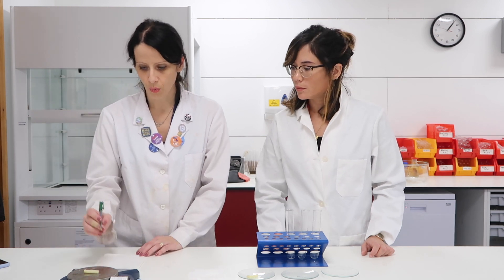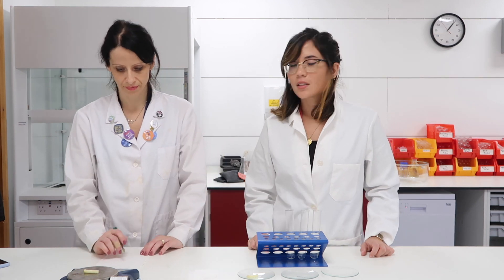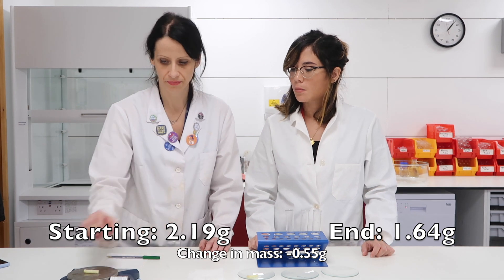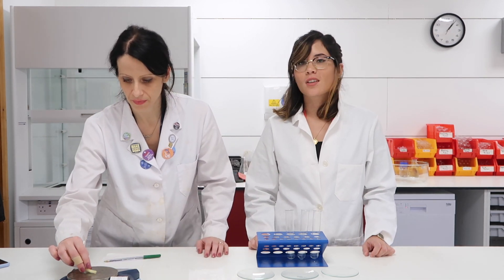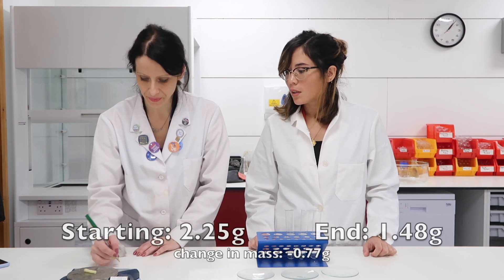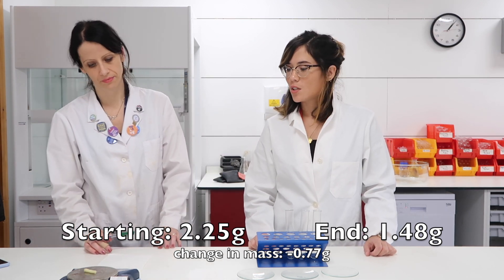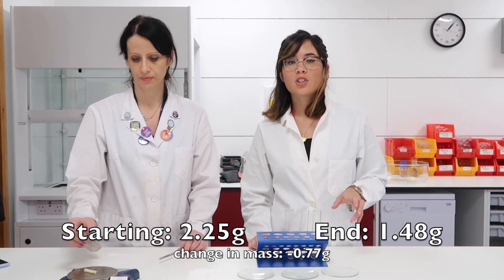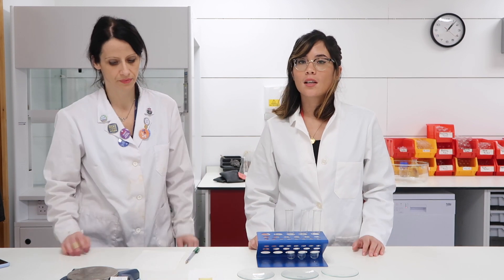The second chip reads 1.64 grams — that's gone down a lot from its starting mass of 2.19 grams, so a large change in mass there. This floppy, sad one is the one that was placed in the strongest salt solution — it reads 1.48 grams. Its starting mass was 2.25 grams and it's decreased hugely to 1.48. So hopefully you can see: in the pure water it gained mass, and in the other two solutions it lost mass.